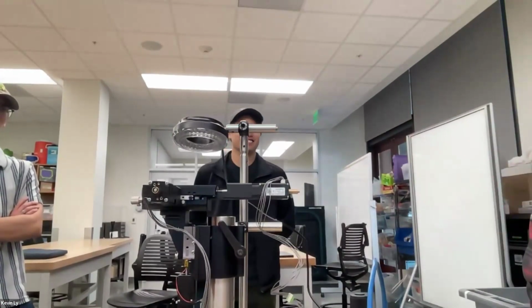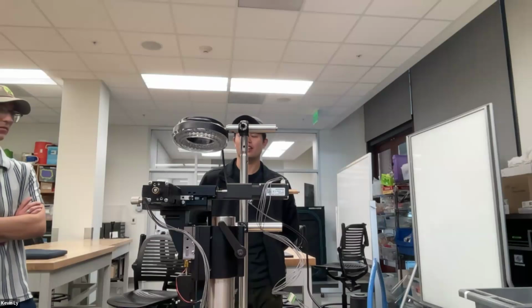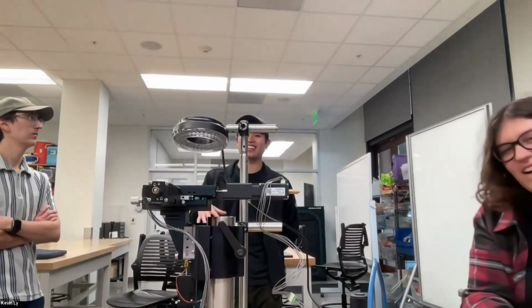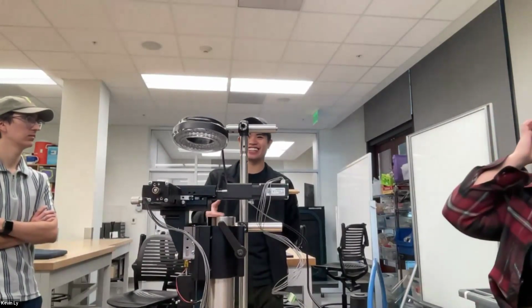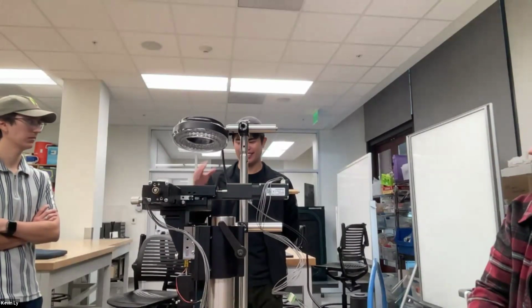Yeah, it's happening now. Oh, were you gonna say that? No, it's just that he put a lot of information out there. If you have any questions about what a driver is, or you want to go more into the optics, we can break it down a little more thoroughly.